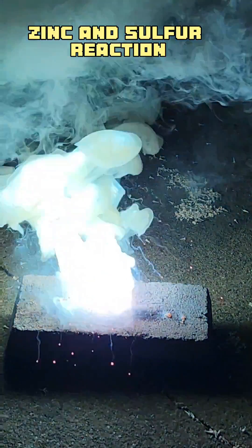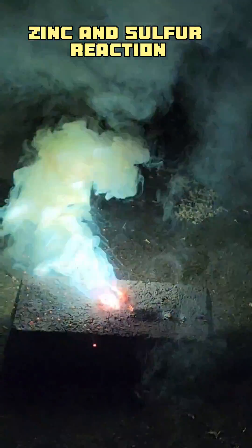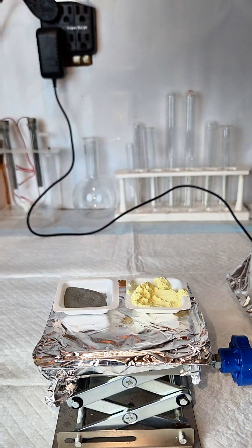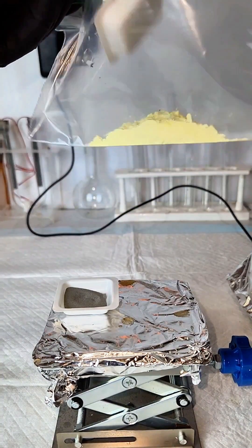This is what happens when sulfur and zinc react directly. The reaction is extremely energetic and produces a characteristic bluish white flame along with the product, zinc sulfide.